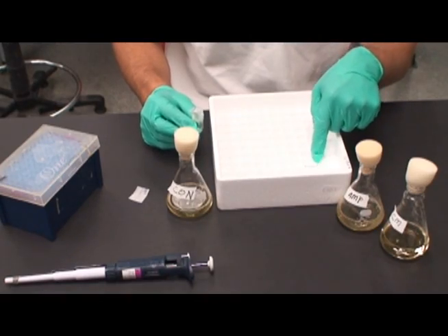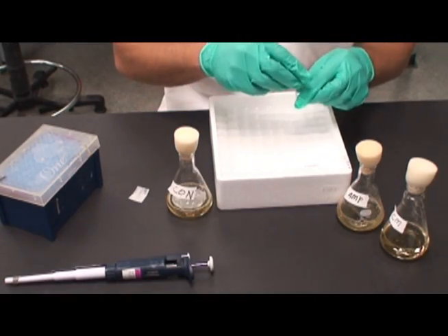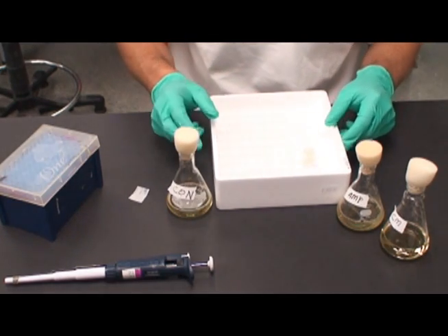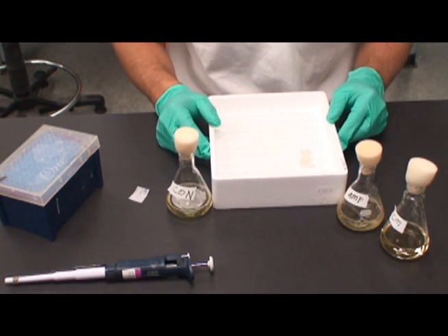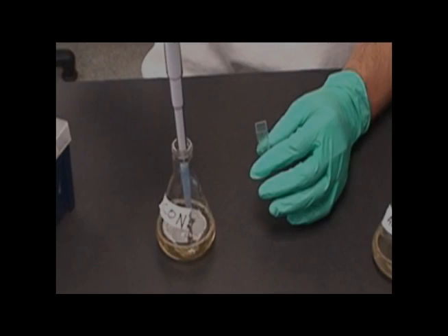An empty styrofoam cuvette tray is an excellent way to keep the various cuvettes organized. If allowable, writing on the tray can also help with organization.